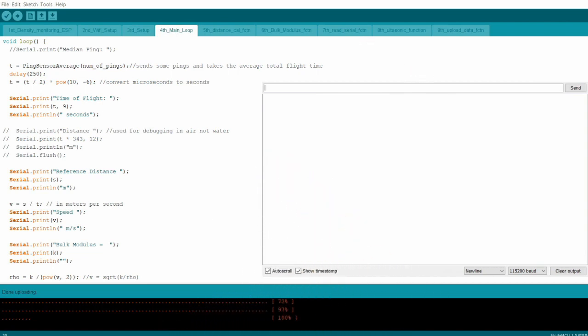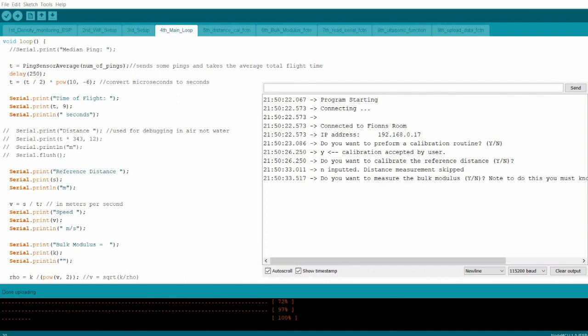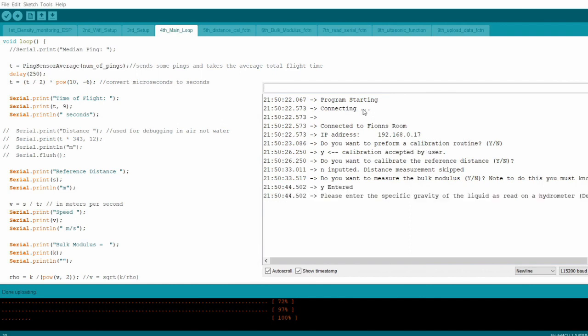But anyway, the code should be uploaded about now. Here we go, connected to the Wi-Fi. And now it's asking to perform a calibration routine. The first thing it wants is the reference distance, which I've already preloaded because I knew that beforehand. That's just the length of the rectangle, so we can skip that. Now it's asking us to measure the bulk modulus, which to do we need the hydrometer reading we took beforehand, which I believe was 1.062.